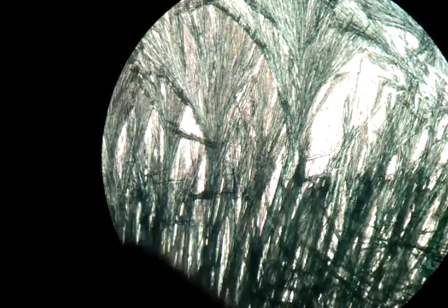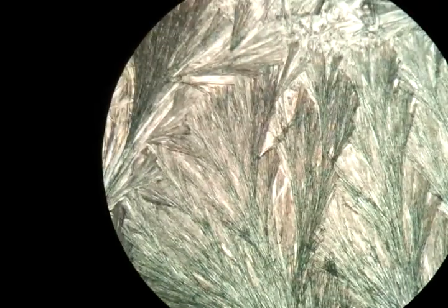And now we're back to the place where the supersaturation, for a moment, the edge is almost indiscriminate from the supersaturation. Out here these formations are really strange. It seems more like it should be with an addition, even though this is a sample without any addition at all.